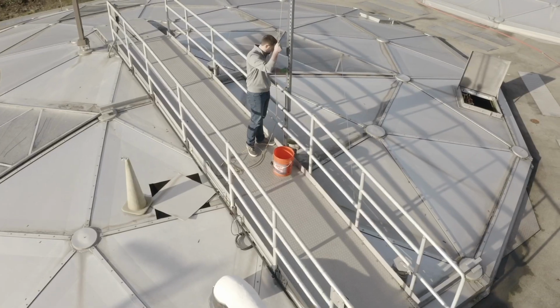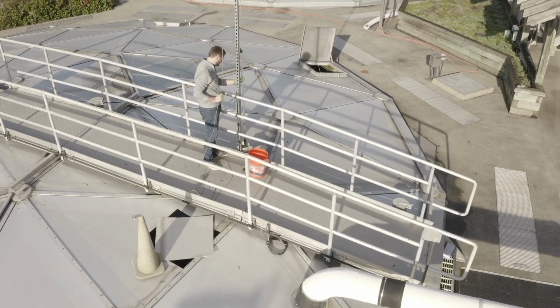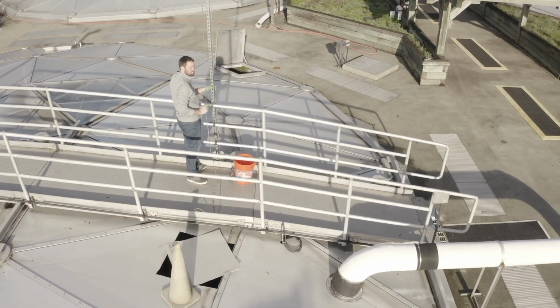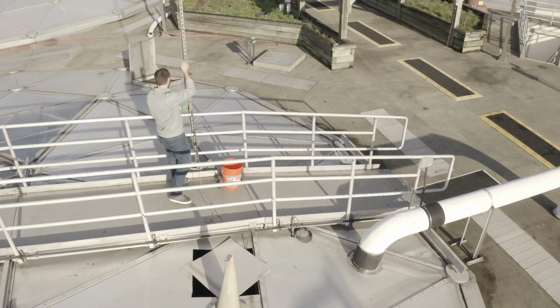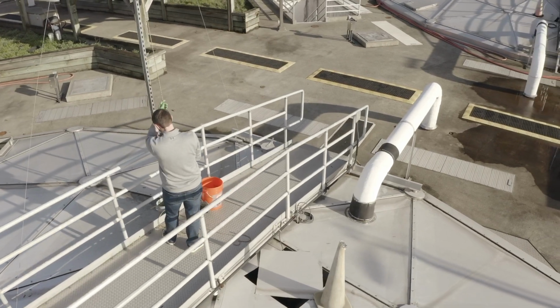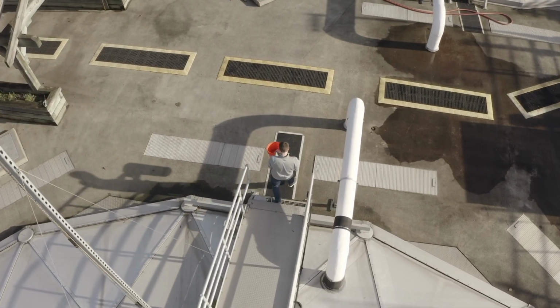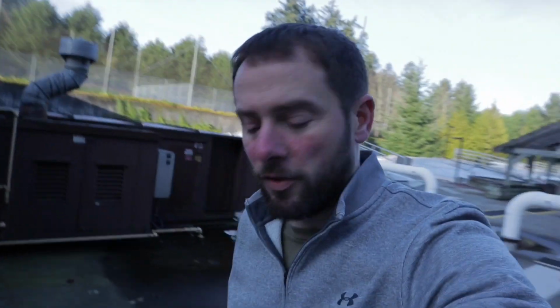So while we're out here, we pay attention to the surface of the clarifier, what the weirs look like. If there's any scum or any formation on top, we want to know about it. It may not be important, but it also might be vital. So once we measure depth of blanket in all the tanks, we can grab that mixed liquor sample and run it up to the lab.